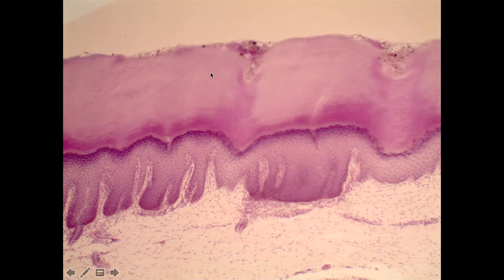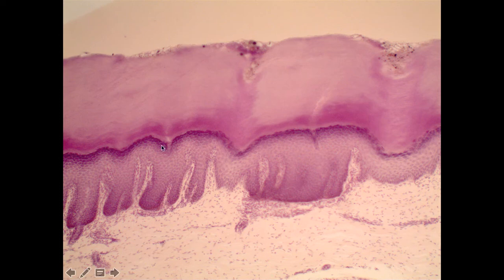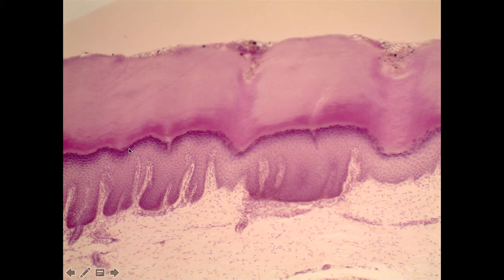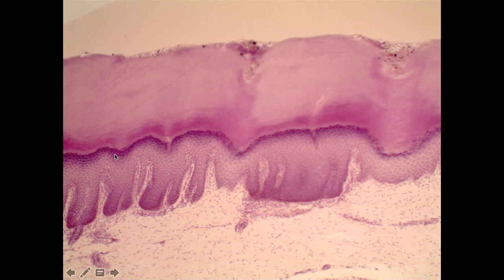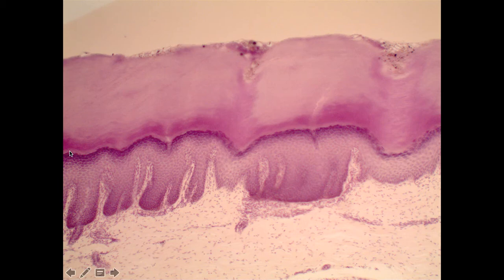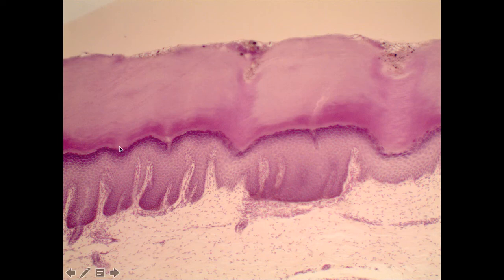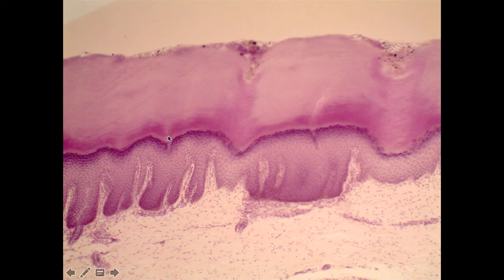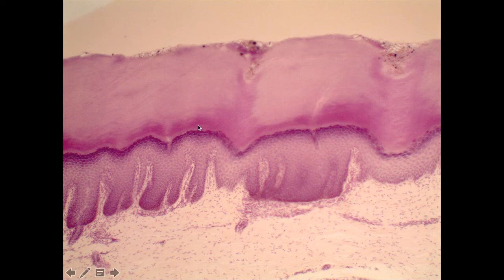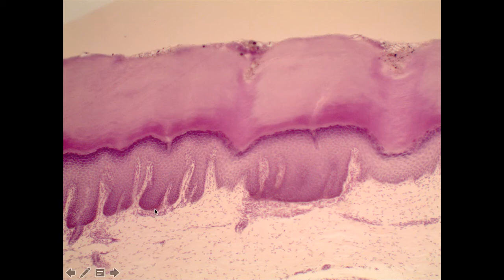Here is a different view of a different slide that shows the stratum lucidum fairly well. You'll notice the stratum granulosum layer — those granule-filled cells with really dark pigmentation. Just outside that, if this is thick skin — and this is absolutely thick skin — there is a very thin layer that seems to lack pigment. This is the stratum lucidum, the fourth layer. And then outside that we see the stratum corneum. Everything from here out to the surface is the epidermis, the epithelial layer.